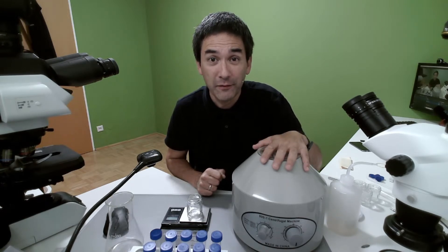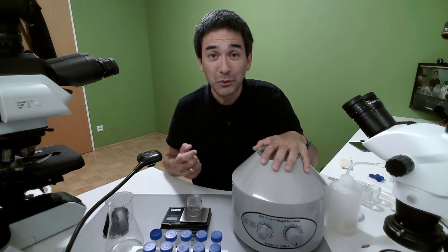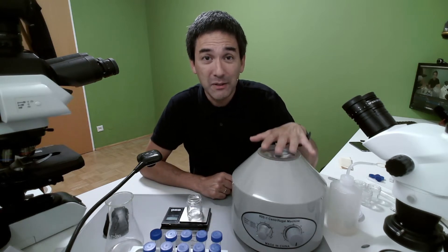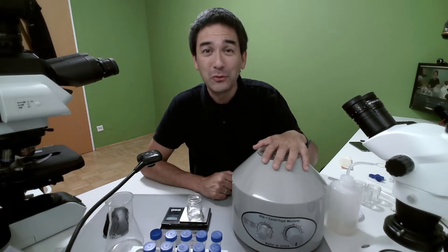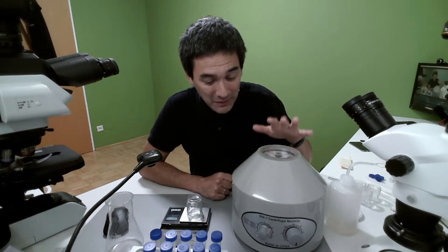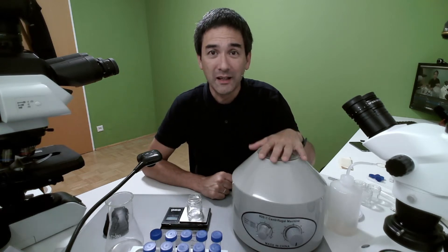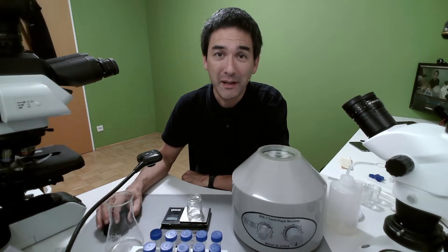Those of you who have been tuning in already in the past have probably already seen me use the centrifuge before. A few of you might be new to the channel and might not have seen it yet, so today I'll be trying the centrifuge again and putting the specimens under the microscope as well.